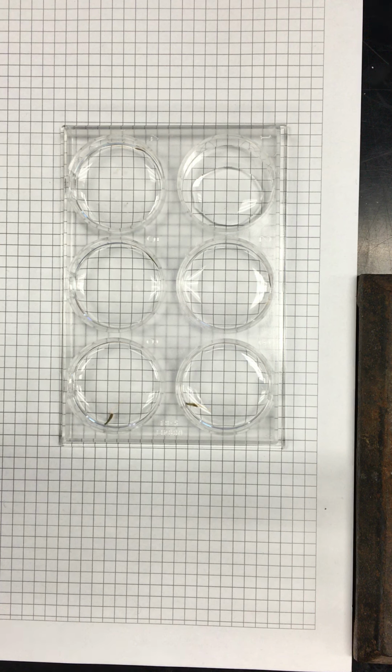So the stock solution is 100 millimolar. If that's your highest concentration, you should be going straight with that. Yeah, because milli... So I can make more, it's not a problem. Did I calculate it wrong? No, you did it right. It should be lower, otherwise these guys are a little more dilute. Maybe you can do it to -3, -4, -5.